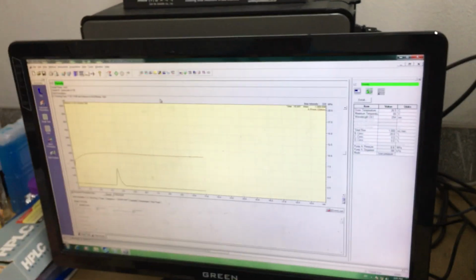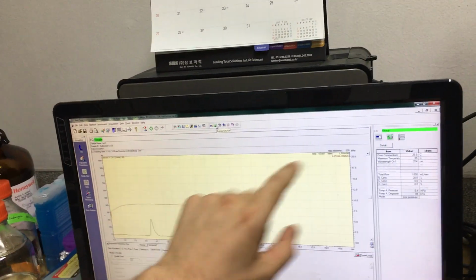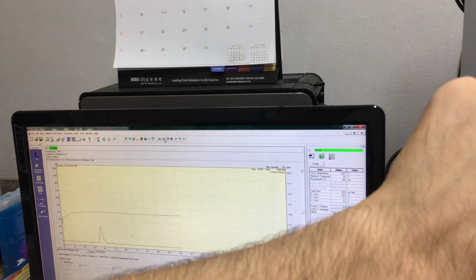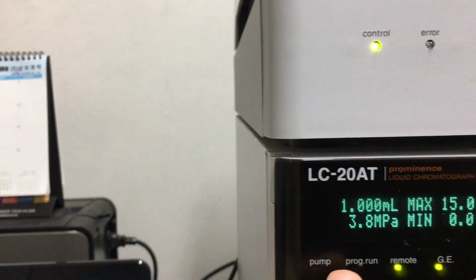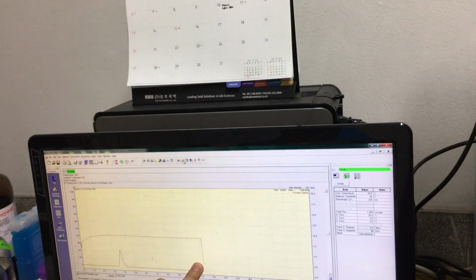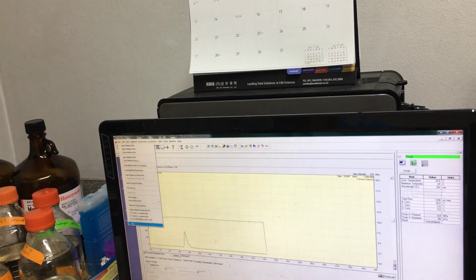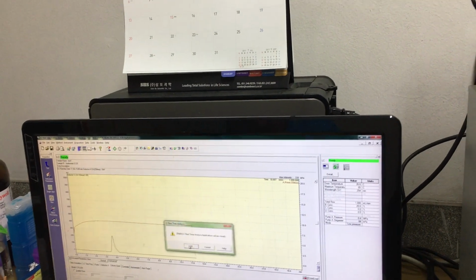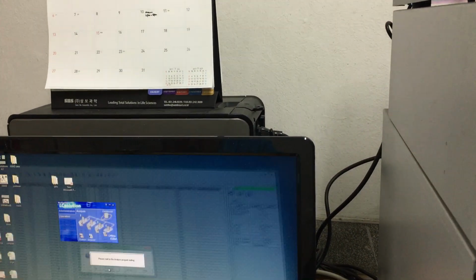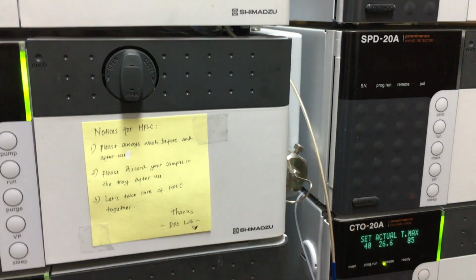And then do not turn off directly. First you need to turn off the pump. You can see the pump, and also the pressure. See, the pressure is decreasing. Just wait until it becomes 0 here. And then file and exit. I don't want to save this data, so it will make a sound, which means perfect. And then just turn off.